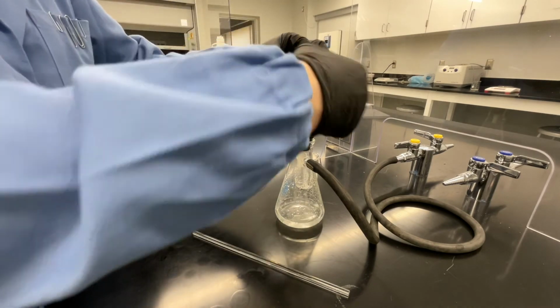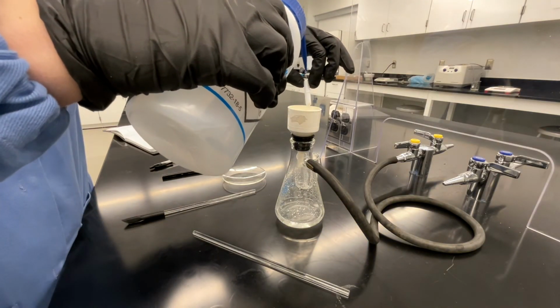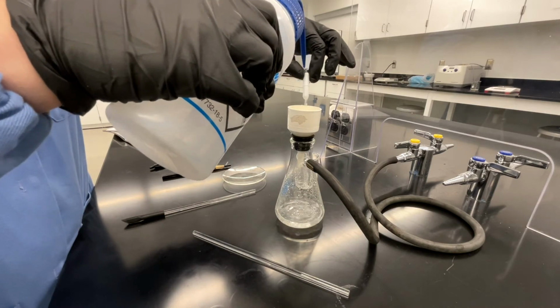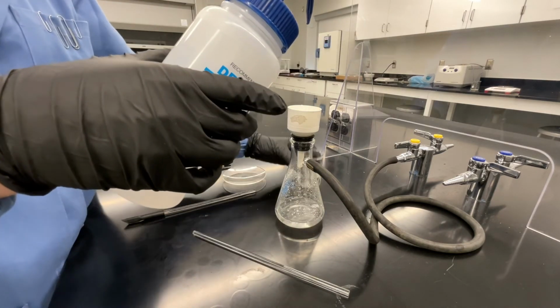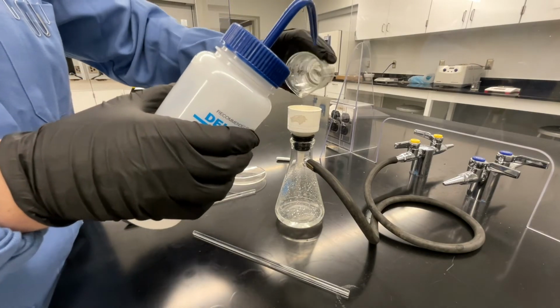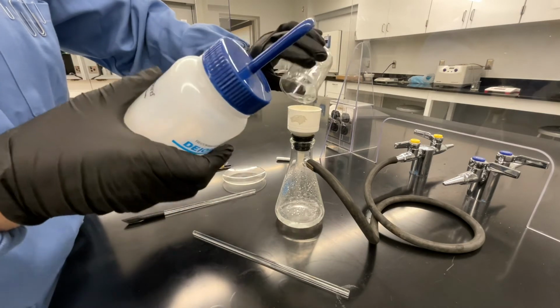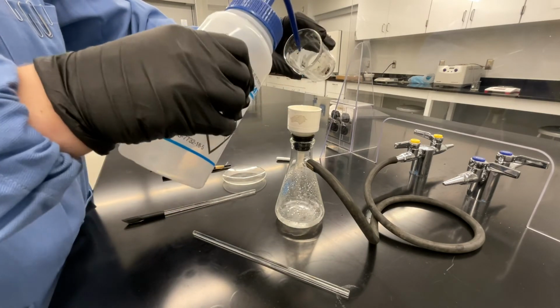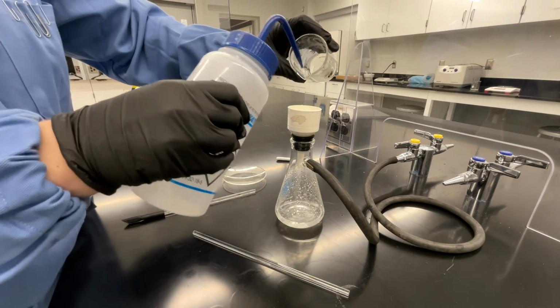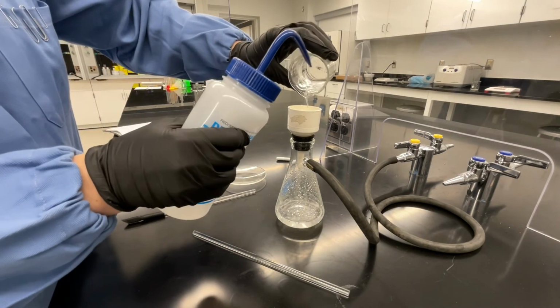If there's any residual solid on the stir bar, you want to rinse it with a little bit of DI water to get the solid onto the filter paper. Now in your beaker, you should just have your solid. Use a small amount of DI water to thoroughly rinse your beaker and to transfer all of the solid onto the filter paper. It doesn't matter how much water you use here because we're only interested in the solid collecting on the filter paper.